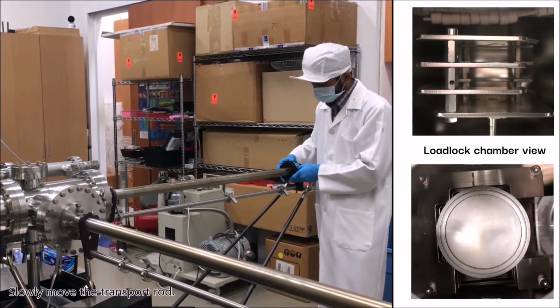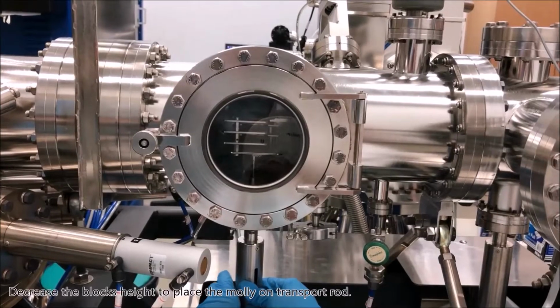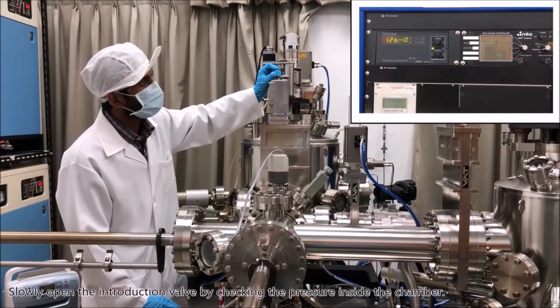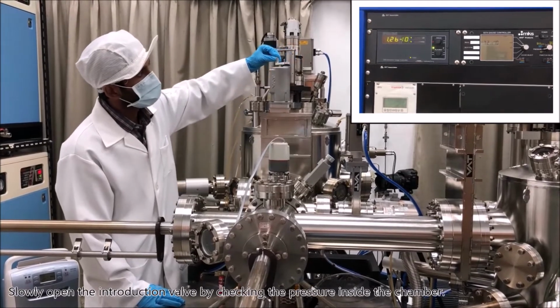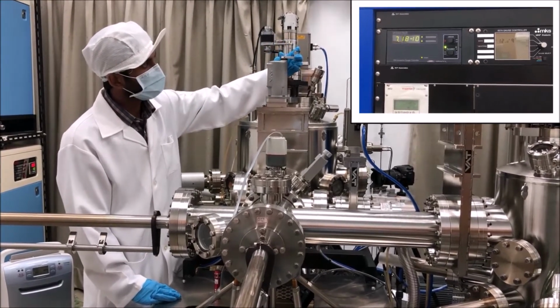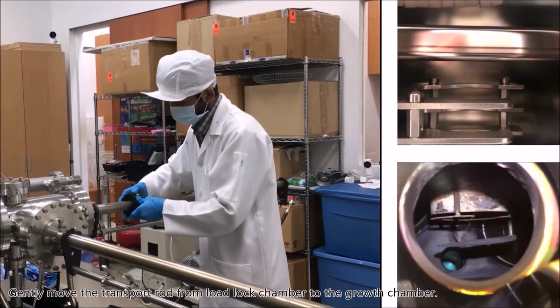Slowly move the transport rod. Decrease the block's height to place the moly on the transport rod. Slowly open the introduction valve by checking the pressure inside the chamber. Gently move the transport rod from the load lock chamber to the growth chamber.